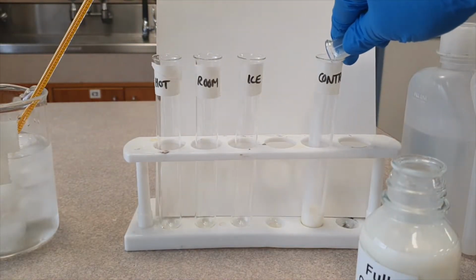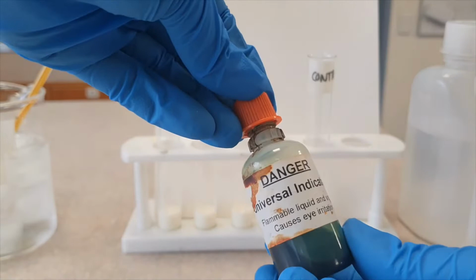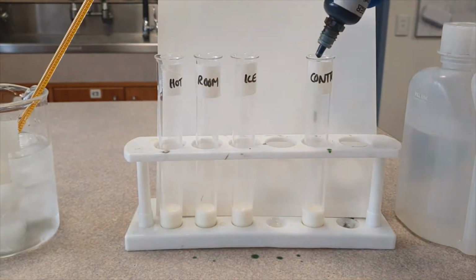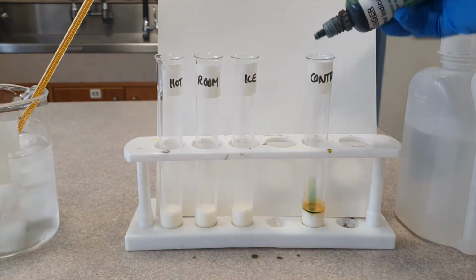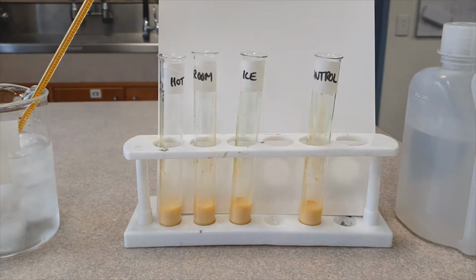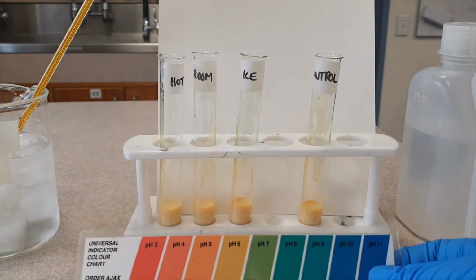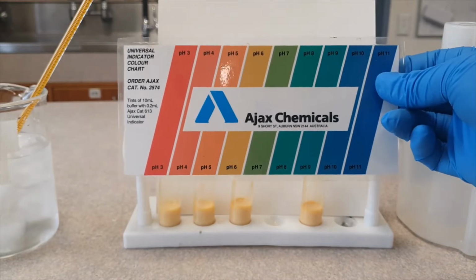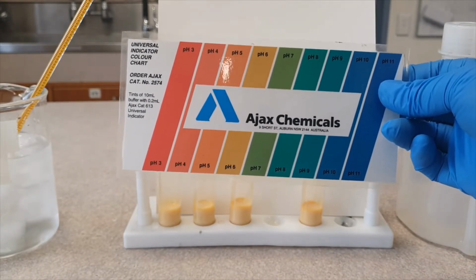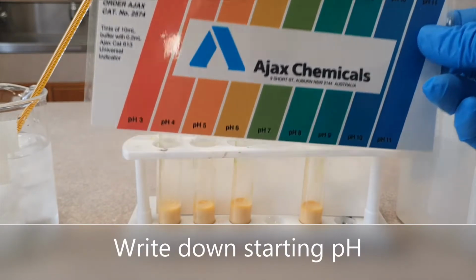And ta-da! Milk's been added. Now, next step, add 5 drops of universal indicator to each. 1, 2, 3, 4, 5. Okay, so we've added the universal indicator. Now, just from that color, you can see that, I'll put it up here. Can you tell me what pH the milk is at from matching the color to the color chart?